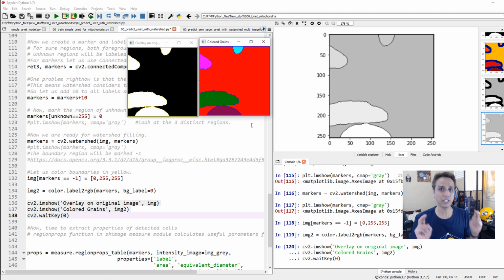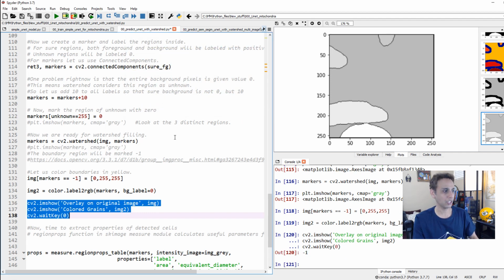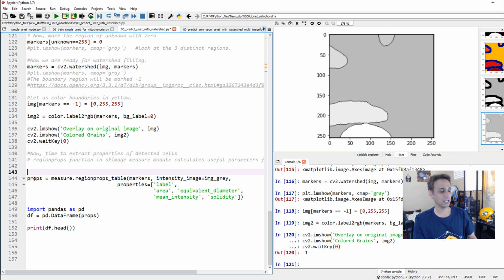So this is like instance segmentation. We did the initial semantic segmentation. Now with Watershed, we separated areas that were close by, and now we have well separated objects. So this is our instance segmentation. Once you have this, getting your object properties is very easy. In scikit-image, you can import measure and regionprops_table. You can also do individual regionprops, but regionprops_table, especially if you have the latest scikit-image, they included this.